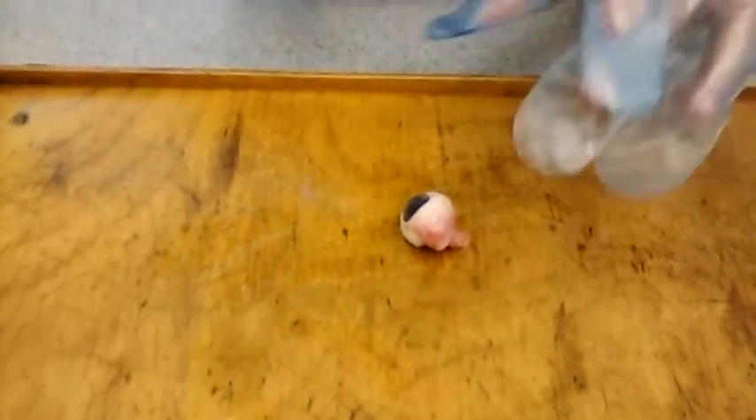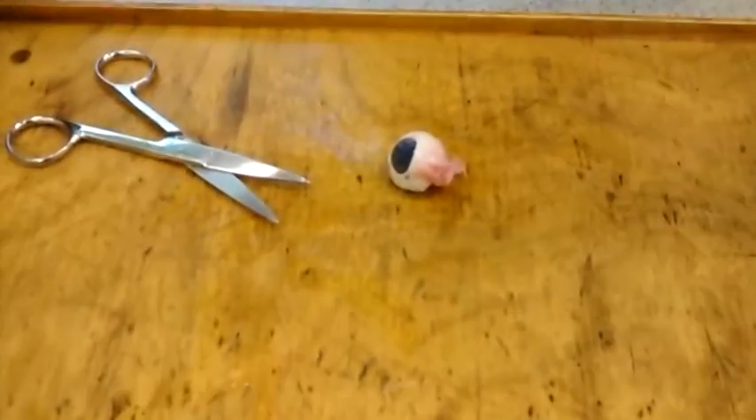Alright, go on Kerry. How can I cut it? You cut it down the middle, don't you? Have a look for the hole in here. It's inside there. Careful — watch your cuts and watch your fingers. Try to cut it away from your fingers. Cut it all the way round, cut it all the way in half.